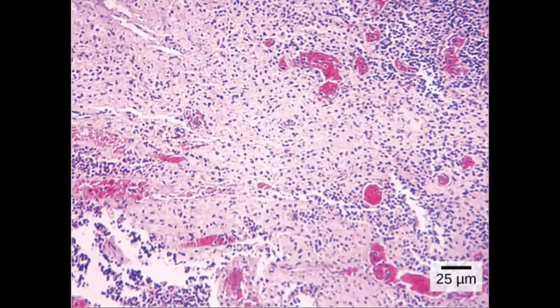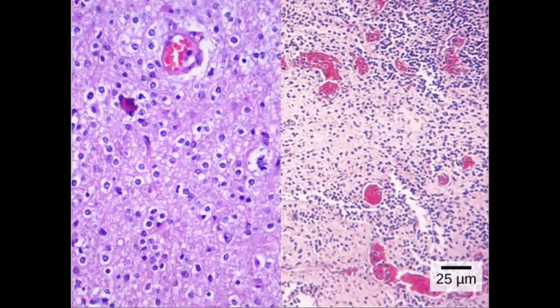So now I hope you may have a better idea on the same slide we started with. So this is an H and E stained connective tissue. You see the blue-purple color cells scattered around and the erythrocytes in red color. This again shows a similar picture, and you can see these erythrocytes or the red blood cells. And also, if you look carefully, you can see this surrounding layer of thin squamous cells. So that is a capillary.